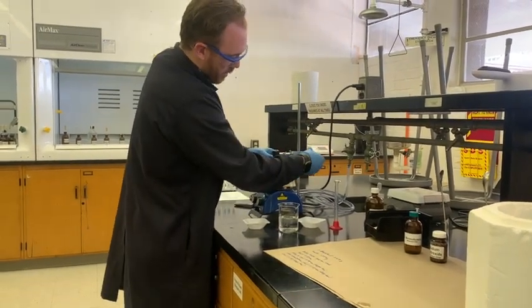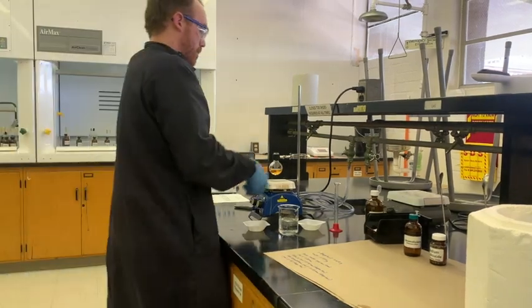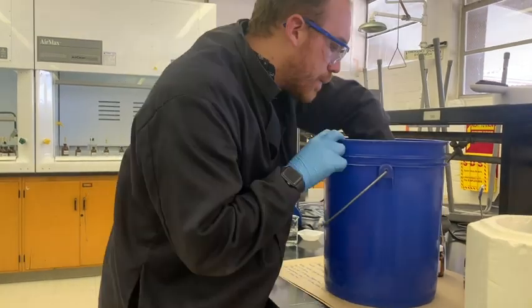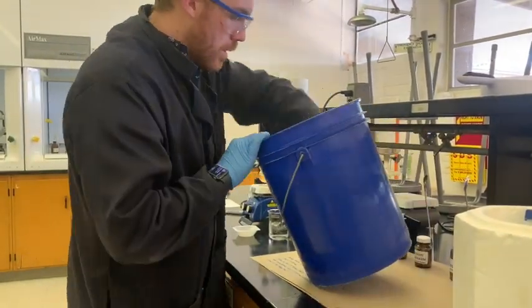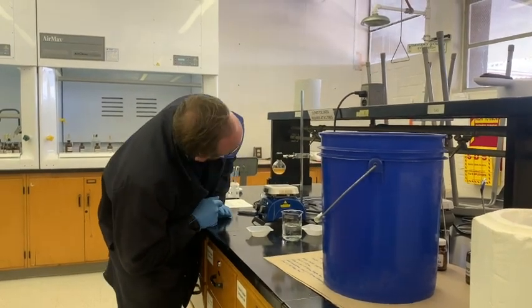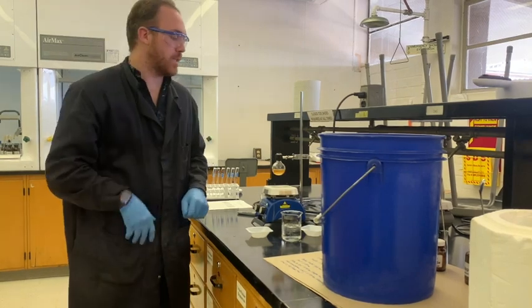It looks like all of the ice is already melted in here, so I'm going to add a little bit more. Now that we've cooled it a bit, you're already starting to see the formation of a precipitate.